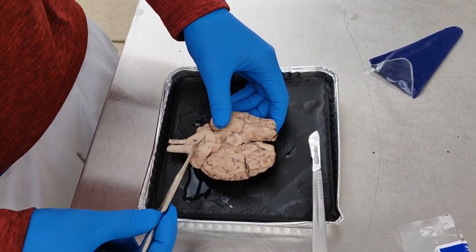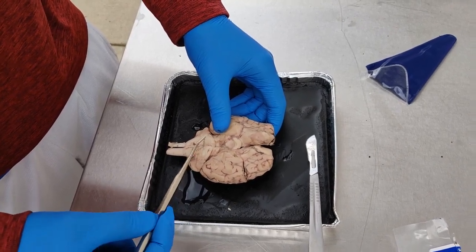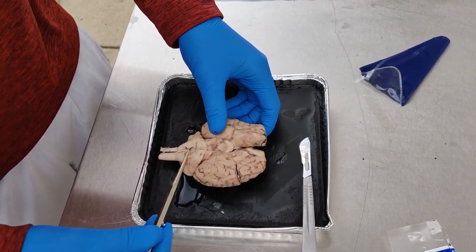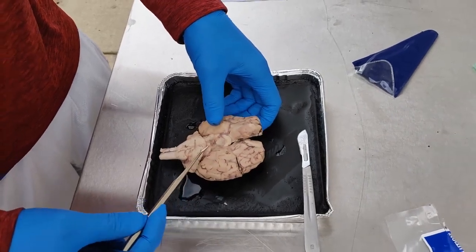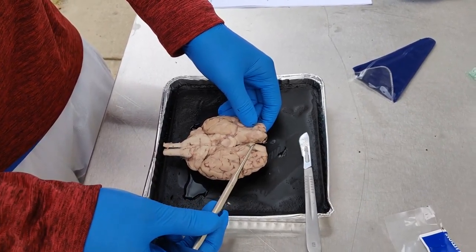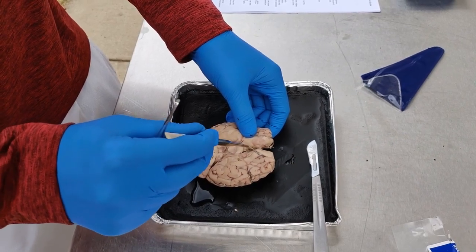The medulla is right over here. This is responsible for respiratory control, other things like involuntary actions, heart beating, all that stuff. And pons is basically all on this side, and that's what connects all the cranial nerves together. The olfactory bulbs are up here, these two. The optic chiasma is right over here, connects these two together.